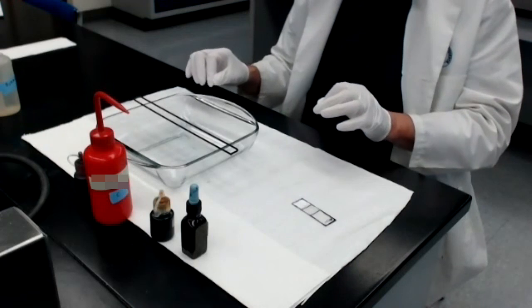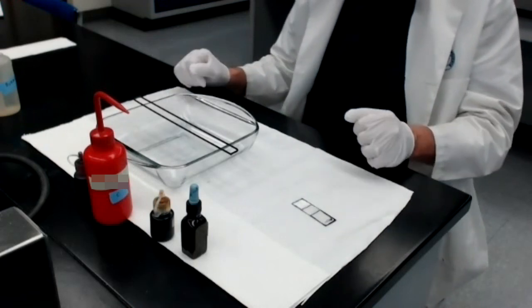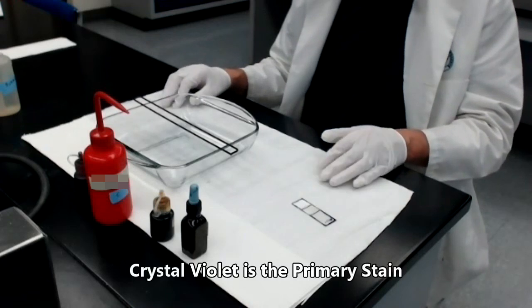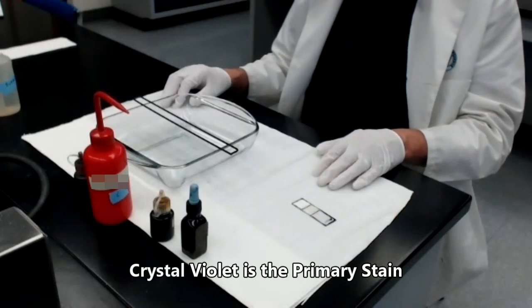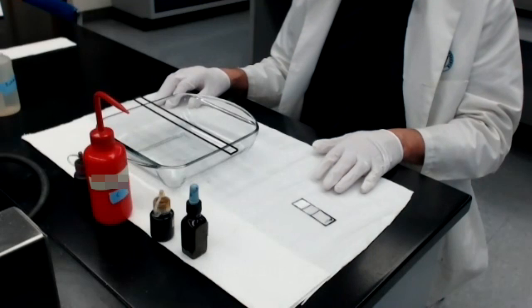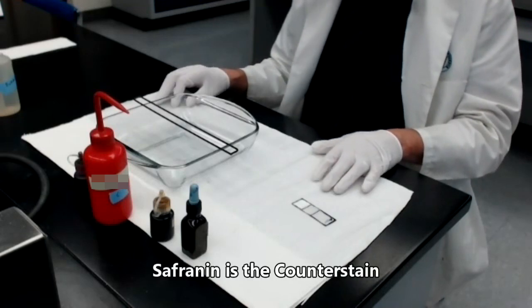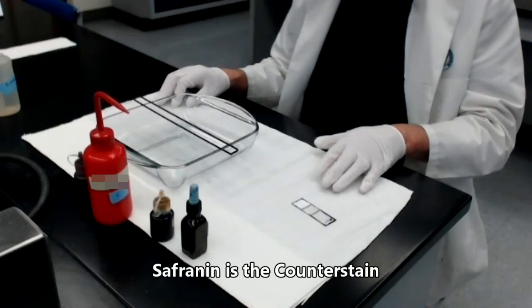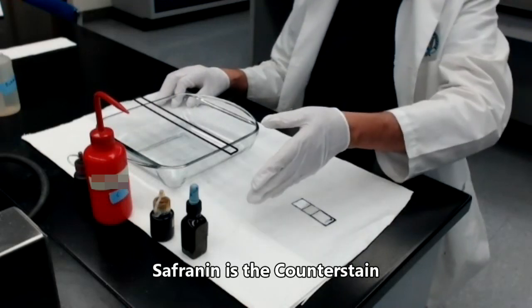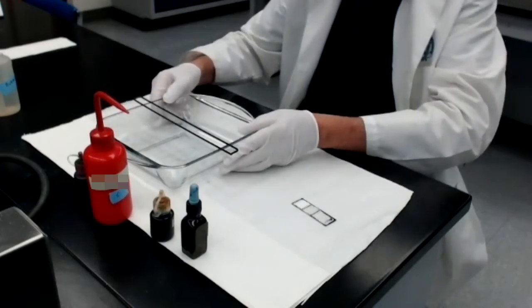In the Gram stain, the primary stain is a staining solution of crystal violet. The counter stain in the Gram staining protocol is a red staining solution called safranin. So the primary stain is crystal violet, which is purple. The counter stain is safranin, which is reddish or pink.